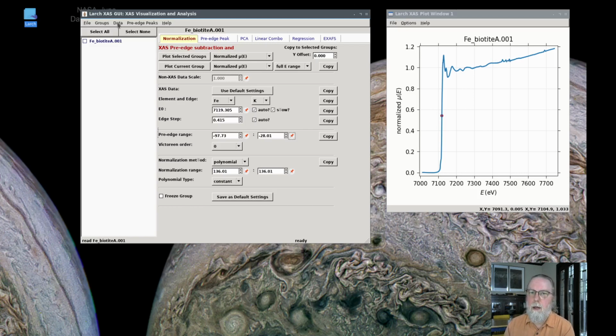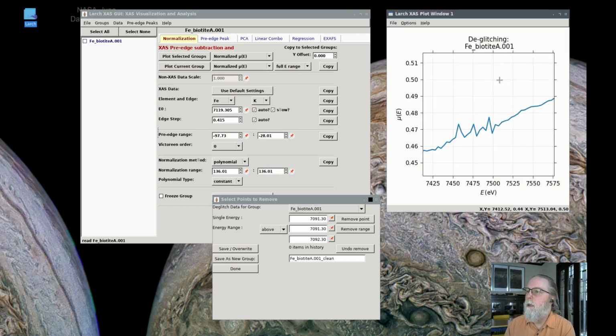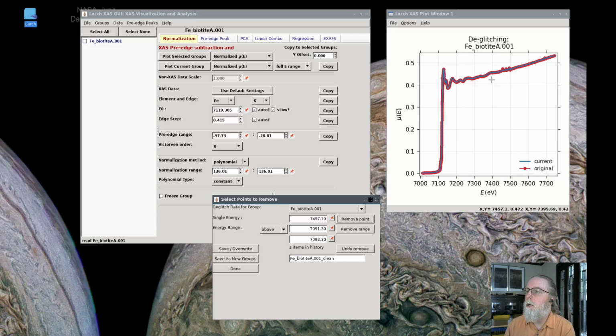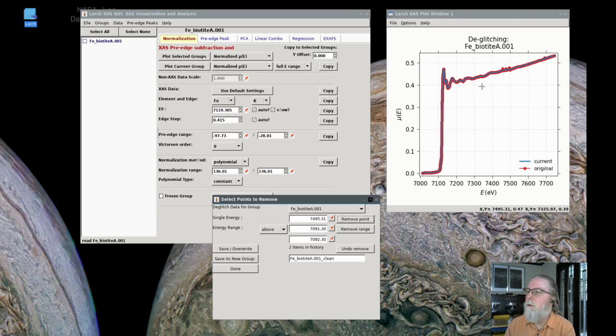So to do that, again, the data menu to deglitch data. That brings up this dialog. We select which of the data sets, which of the groups we want to work with. And now we can select a single energy or a range. So I'll zoom in here, and let's say I want to remove this point. So I click close to there and then select the pin here to use the last selected point from the plot. That's 7457. If I remove that point and now show this, you can see that that's removed that point. It hasn't tried to interpolate, it just removed that point. And we might want to remove some other ones. So if I say that point, now let's remove that one as well.